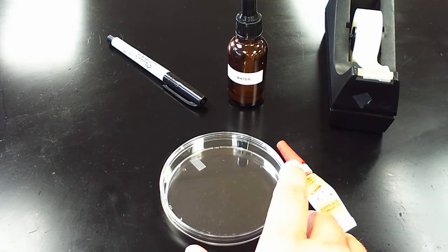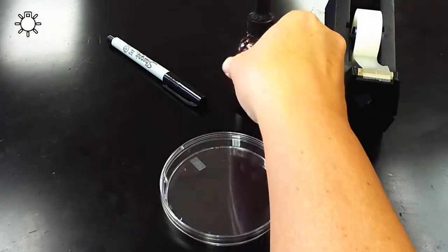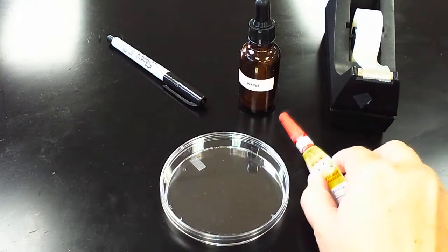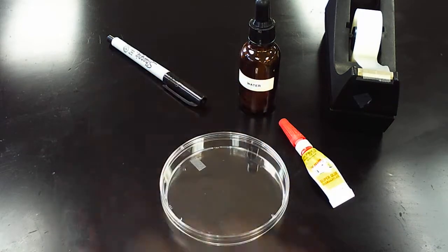You would also need a dropper of water, a little bit of water in there, some super glue, some tape, and a sharpie marker.